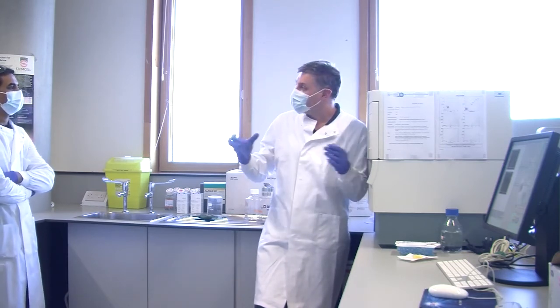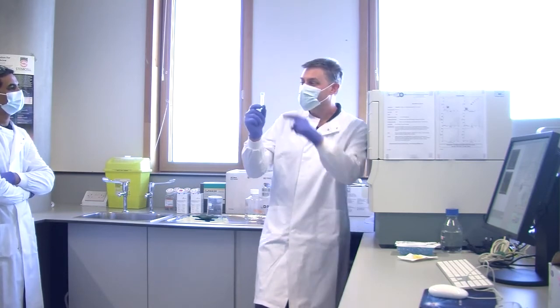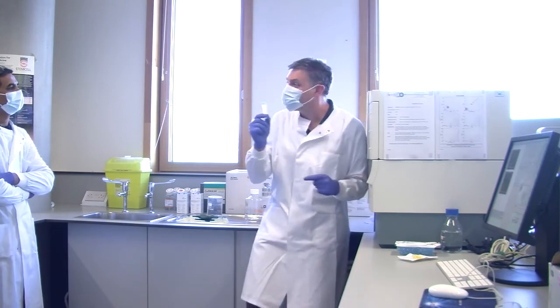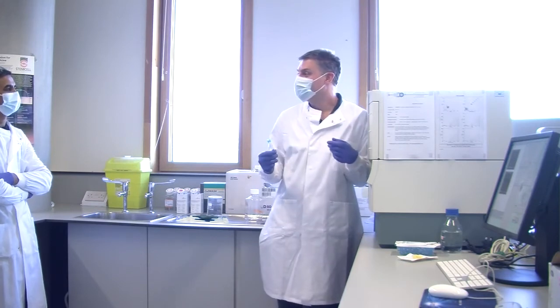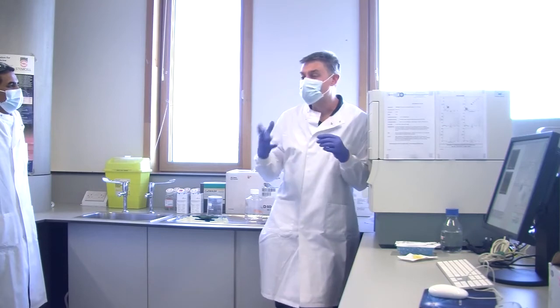They then stick together during your labeling process. You put them through the filter, and all of your stem cells are stuck in there. You put the tube on the machine, and you're only putting through the non-stem cells. So of course you're going to have very, very few of them. All of a sudden, your data is wrong. Of course it could be the other way around.